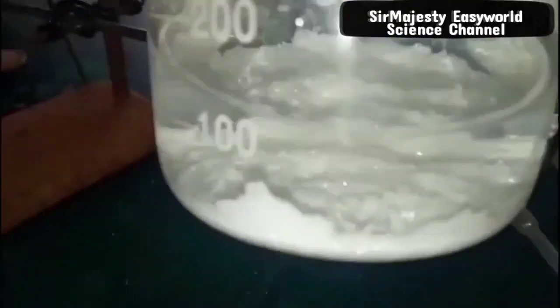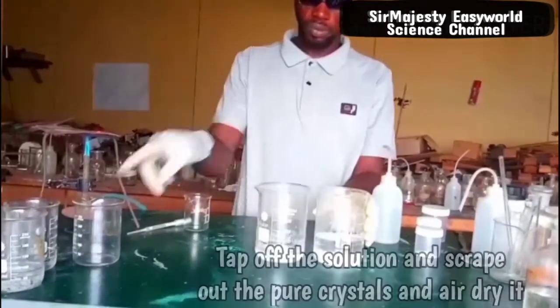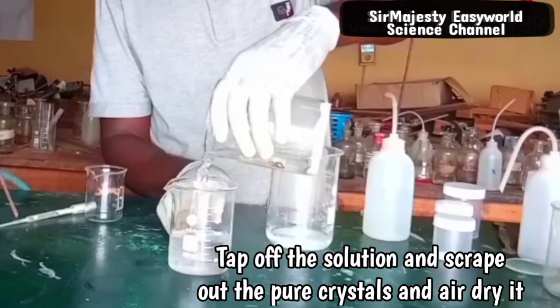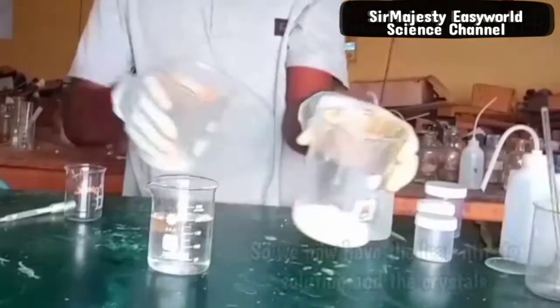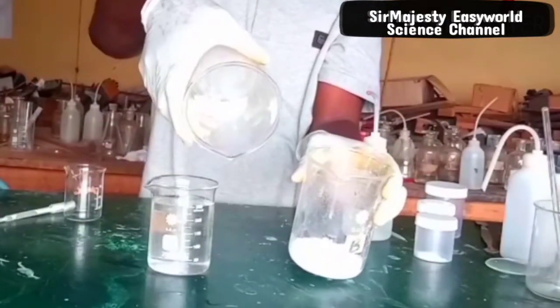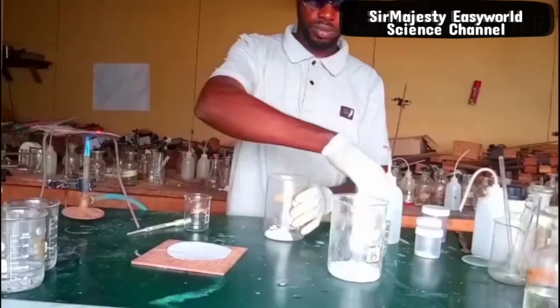You can see the pure crystals of lead nitrate forming from the solution. I left it to stand for the whole day. The next day, I decanted off the remaining solution. The solution is still lead nitrate solution, as the subsequent test will show. You have the lead nitrate crystals — that is the solid there. I then scraped the solid crystals of lead nitrate out and dried them.